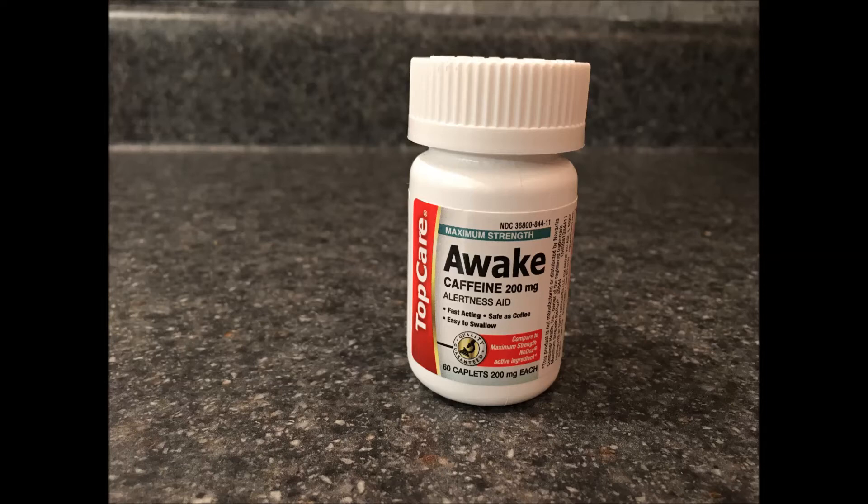Today I will be extracting caffeine from caffeine pills. If you plan on consuming this caffeine, make sure you use food safe equipment.